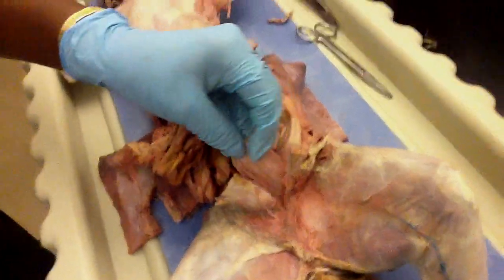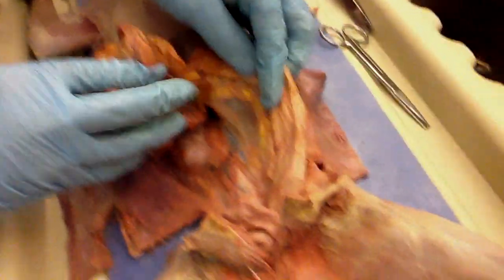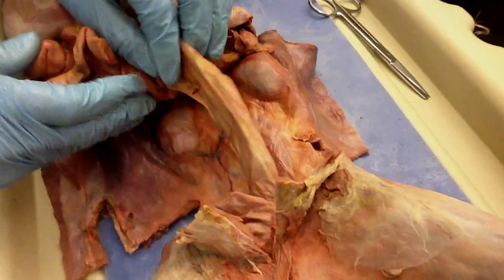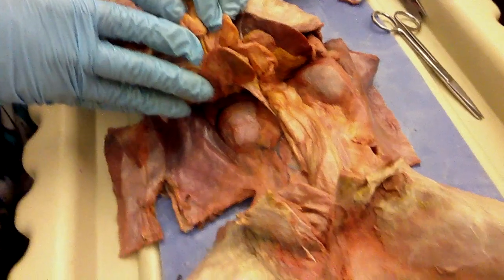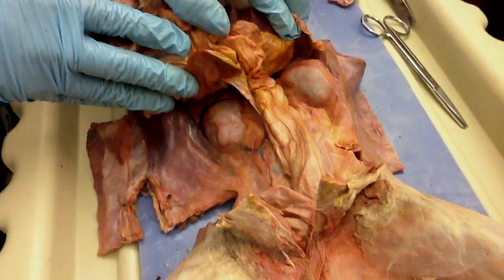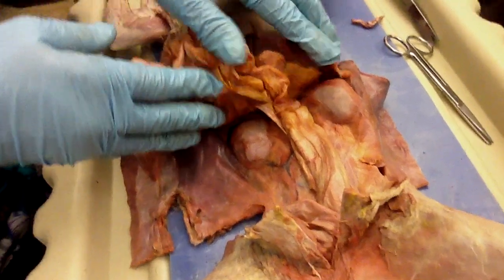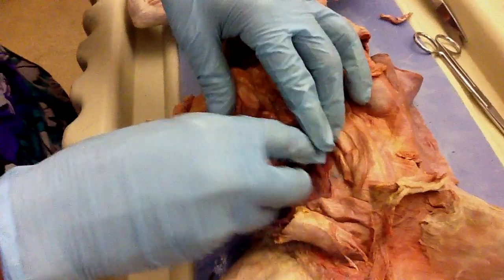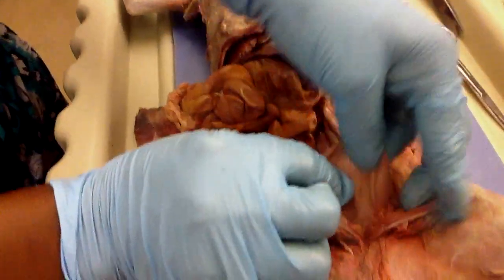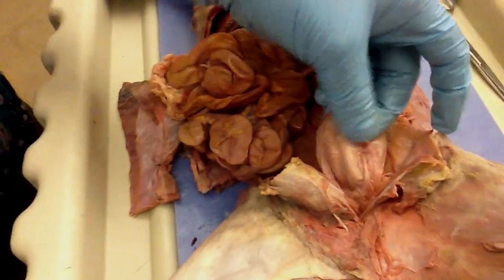We got it. So make sure you can find the kidneys, the two kidneys, and your urinary bladder right now. Just don't call it a bladder, because there's a gallbladder too. Gallbladder, urinary bladder, and the kidneys. That's perfect. We're gonna love this. This is the urinary system.